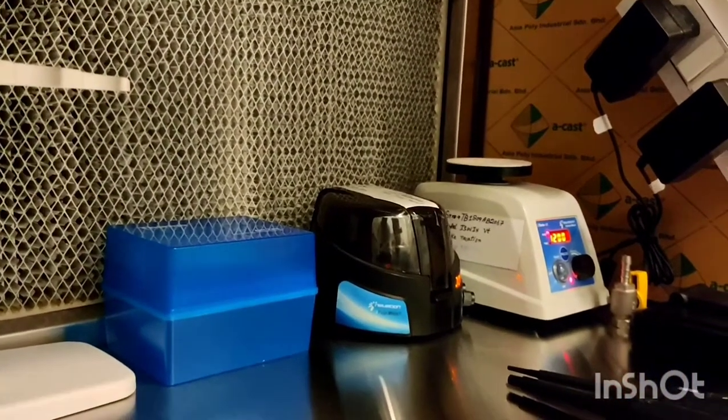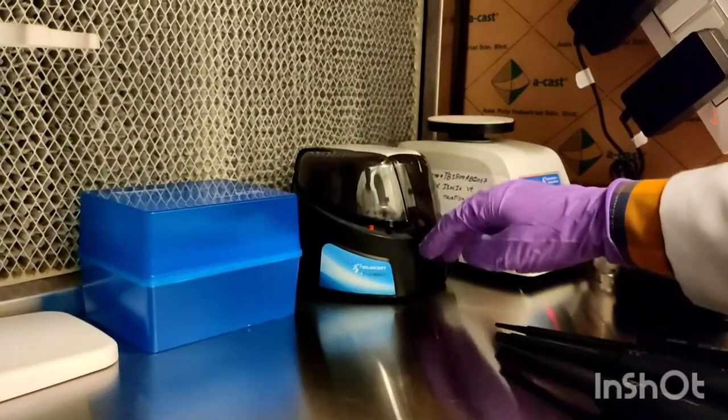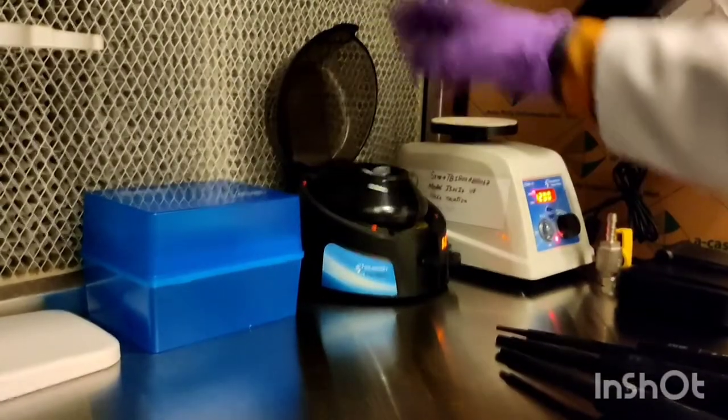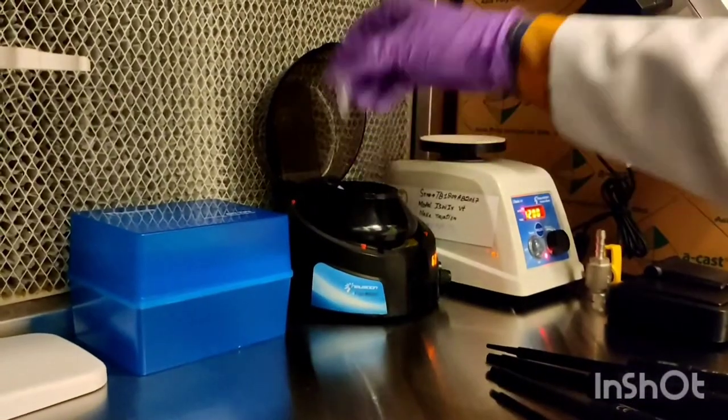The whole procedure is to be done in a laminar airflow cabinet. Centrifugation is complete.